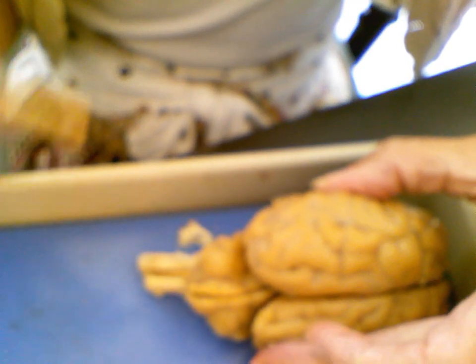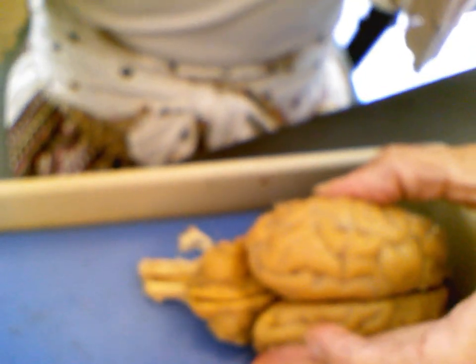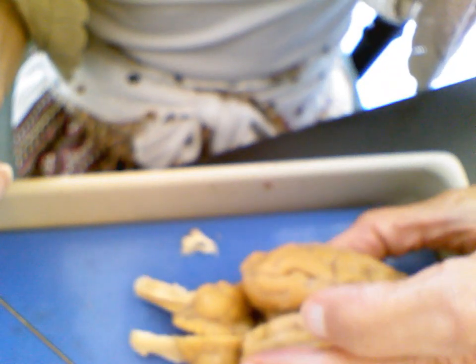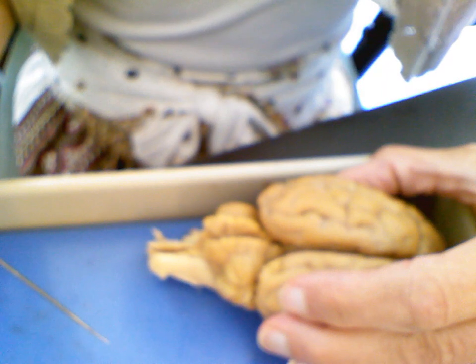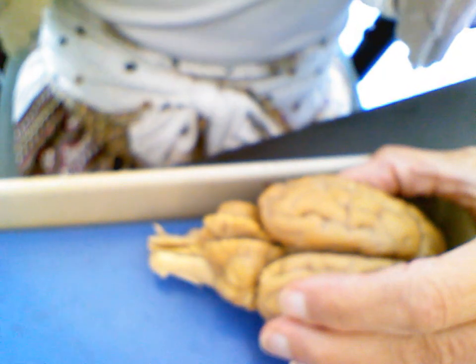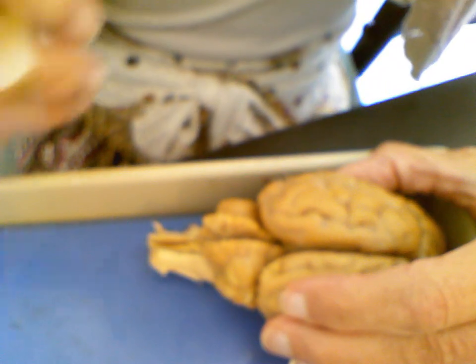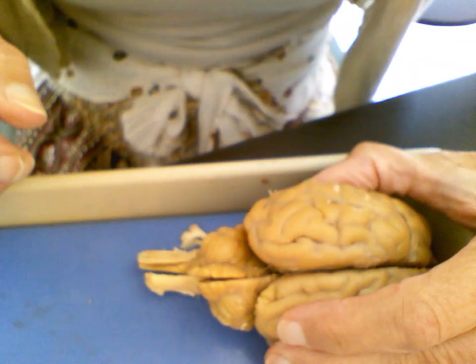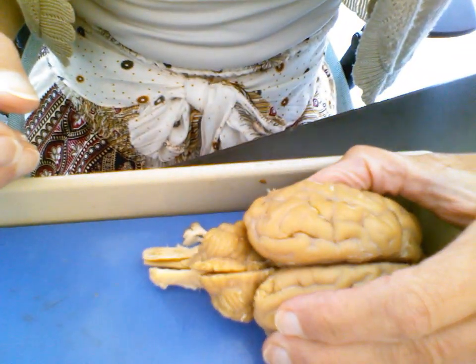How can we get it a little clearer? Let's see if we can autofocus a little bit. Let's turn that autofocus on. Sorry. Let's see if we can get that to go on. There we go. Let's see if we get any better focus here. Autofocus, where are you? It's still not too focused, so let me try another tack here. Let's turn that off. See if we can focus it now. Maybe a little better. Yeah, it's actually a little better if I don't move too much.